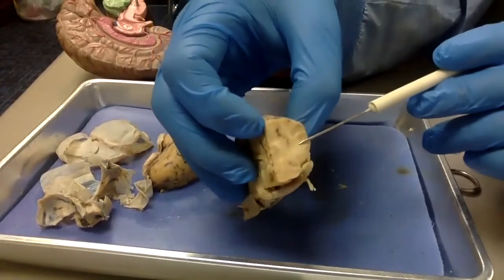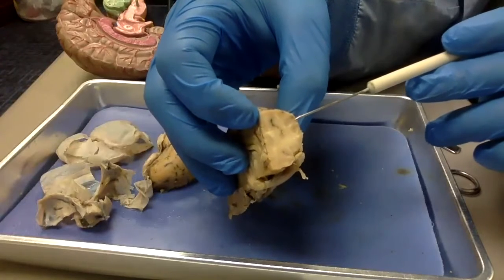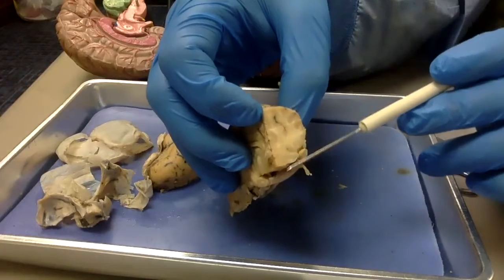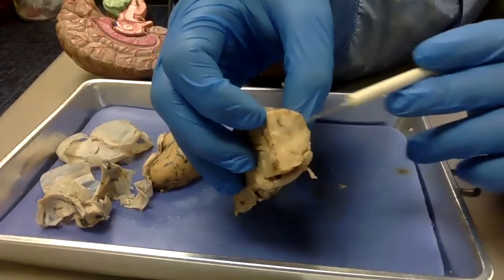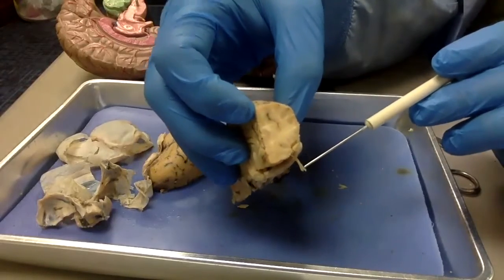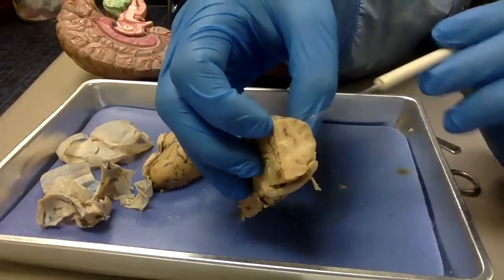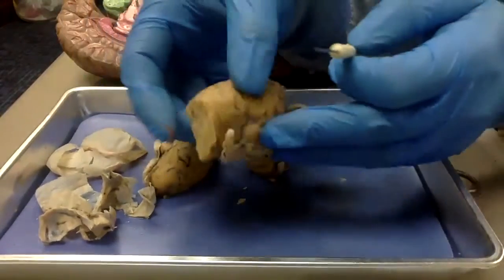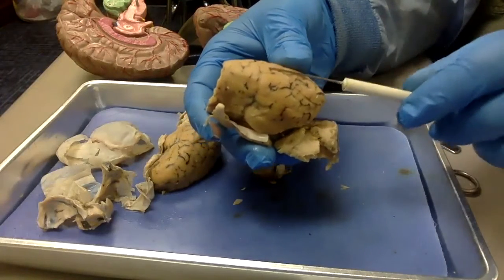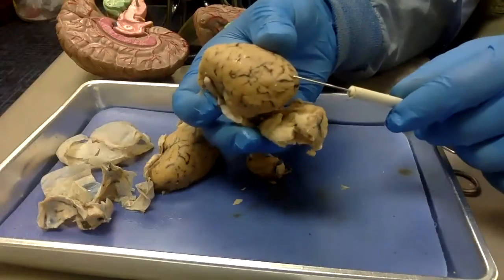And then the white is all the axons, the tail of the neuron, right? Once the information is shared in the synapse, an electric impulse can travel through these axons, going in all these different directions because there are a bunch of different axons there, sending information to different parts of your brain. That's what the white matter does. You have a thought here in the front, and the white matter axons can send it over into the back, where you have some memory and processing. Over here is the occipital lobe.